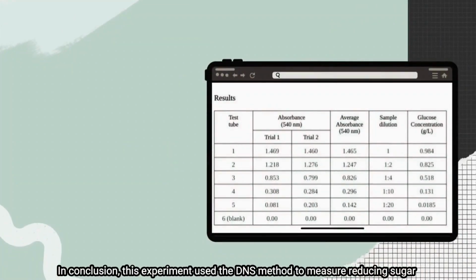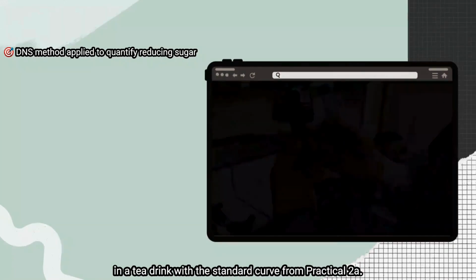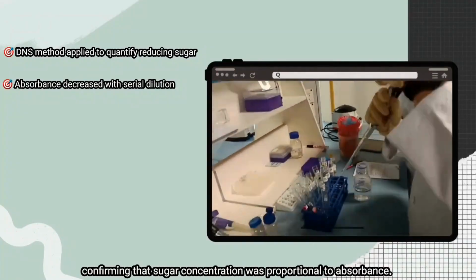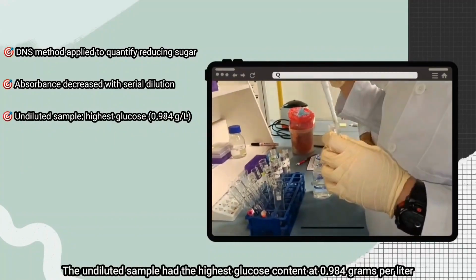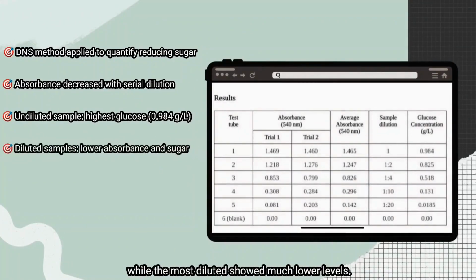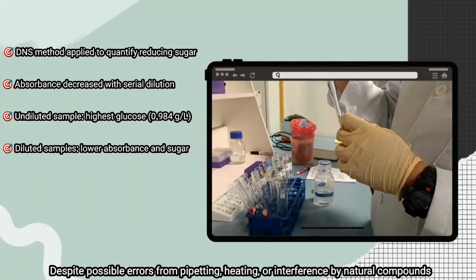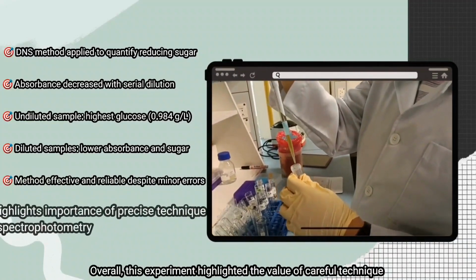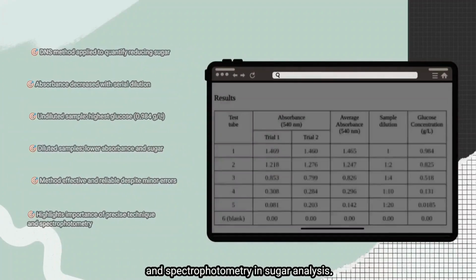In conclusion, this experiment used the DNS method to measure reducing sugar in a tea drink with the standard curve from Practical 2A. Results show absorbance decreased consistently with dilution, confirming that sugar concentration was proportional to absorbance. The undiluted sample had the highest glucose content at 0.984 grams per liter, while the most diluted showed much lower levels. Despite possible errors from pipetting, heating, or interference by natural compounds, the method remained effective and reliable. Overall, this experiment highlighted the value of careful technique and spectrophotometry in sugar analysis.